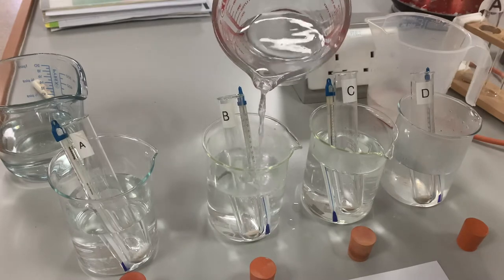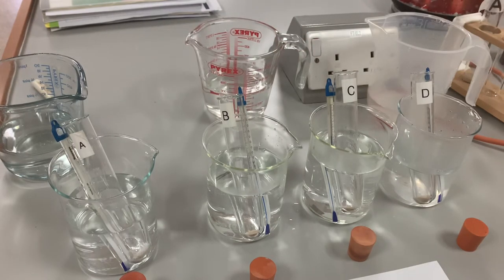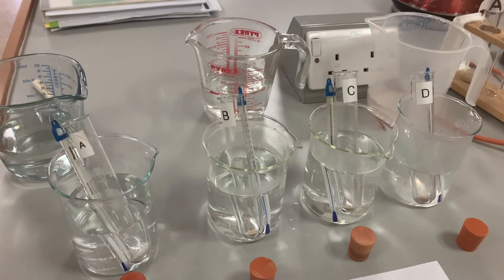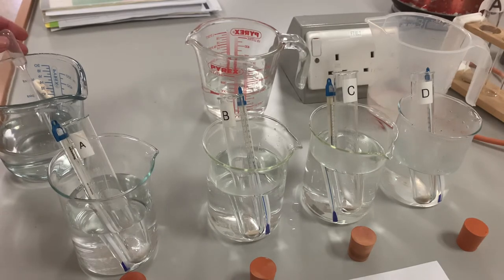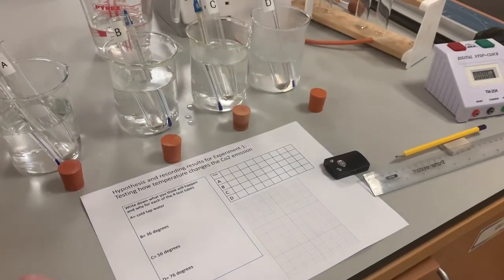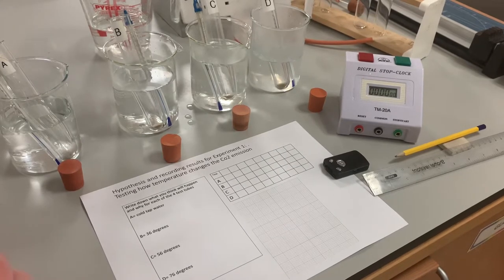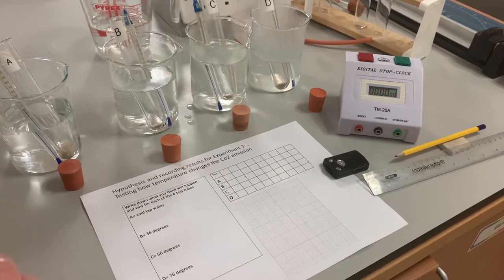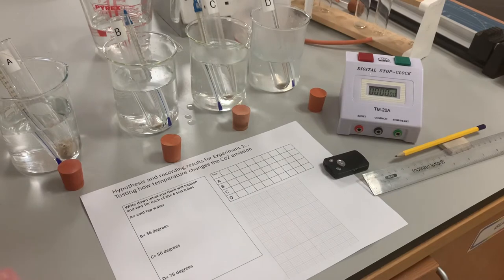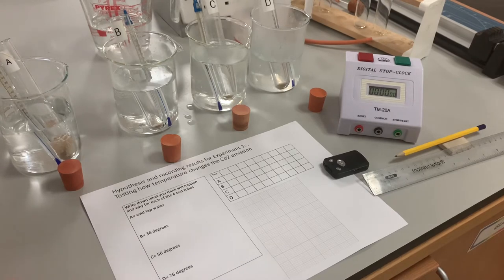I've put the same amount of yeast in each one. Now we're going to activate each one with the glucose solution. Then we're going to time five minutes to see which one produces a froth, and we're going to measure the froth. I've got my record sheet ready and my timer at hand. I'm using a pipette to make sure that each of the boiling tubes has the same amount of solution, so it's a fair test.